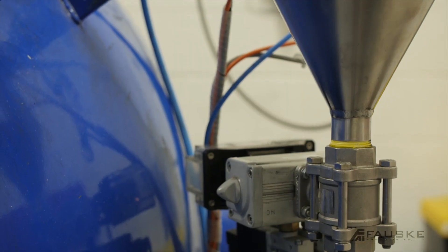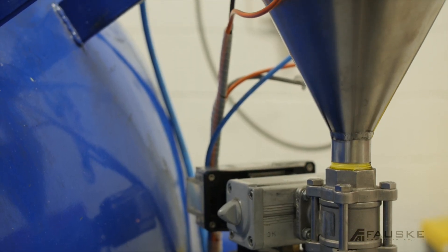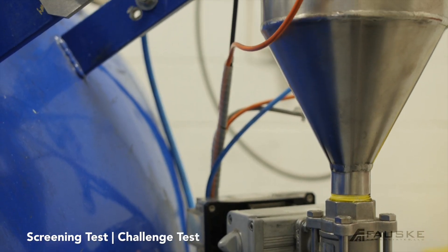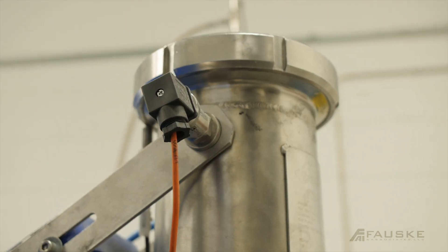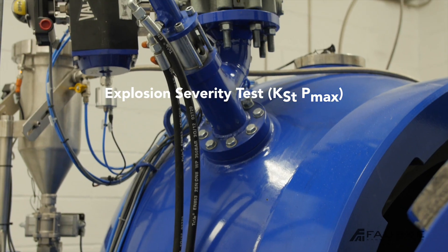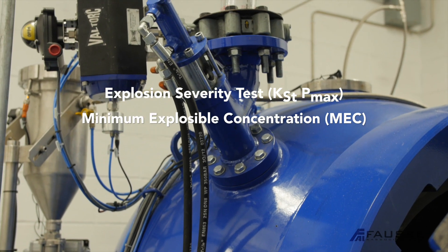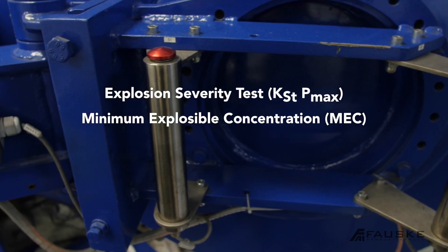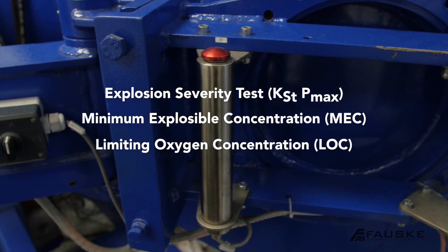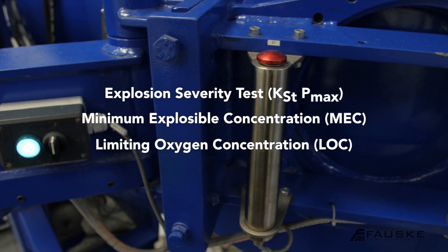The tests performed in this chamber are the screening test, also known as the challenge test. Other tests are the KST, minimum explosible concentration, and limiting oxygen concentration.